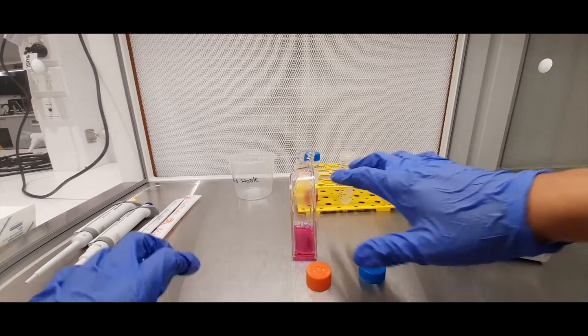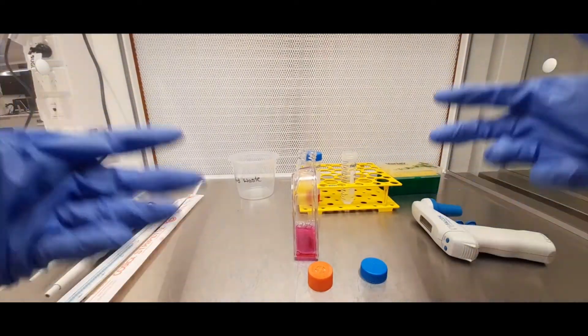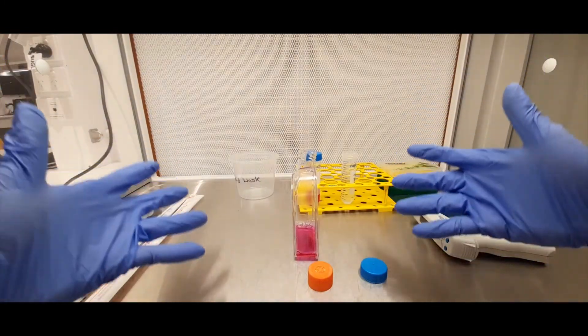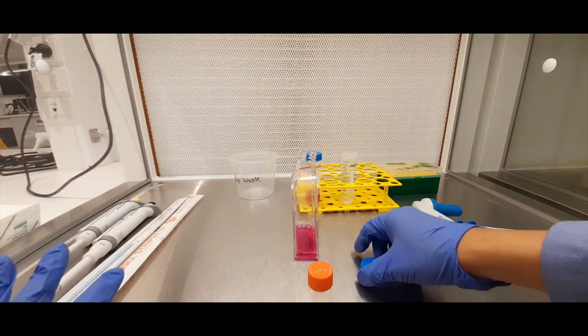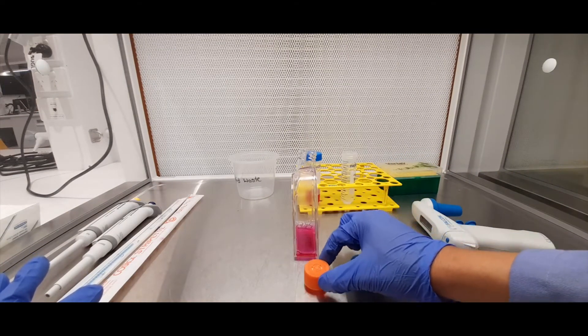So remember this work surface is nice and clean and sterile. It's been UV irradiated. You've sprayed it with 70% ethanol so it's nice and clean. So actually it's perfectly fine to put these caps face down.